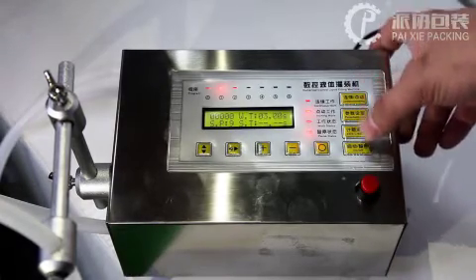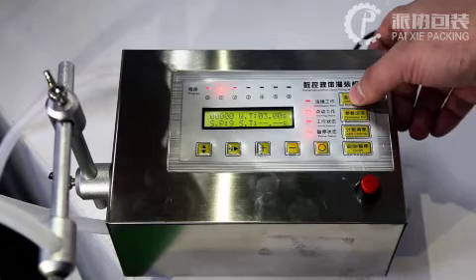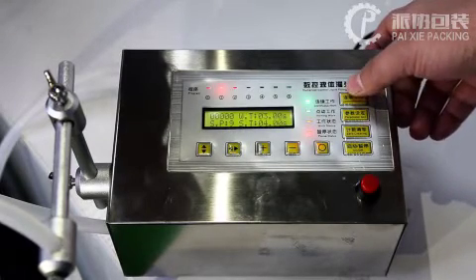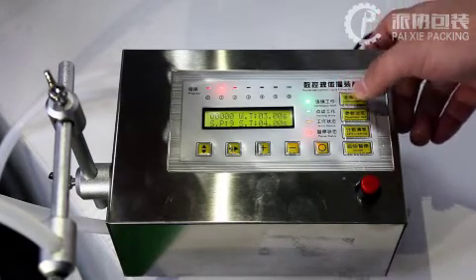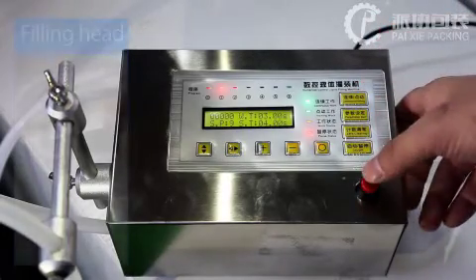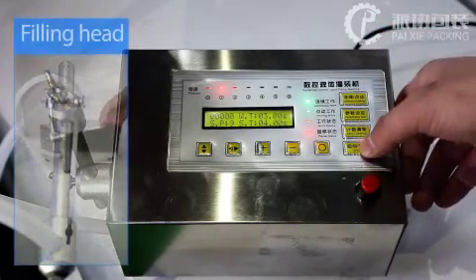Let's test. Right now this is continuous working. And press power up.